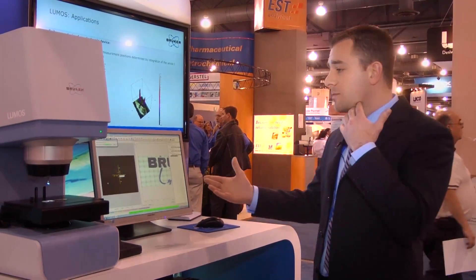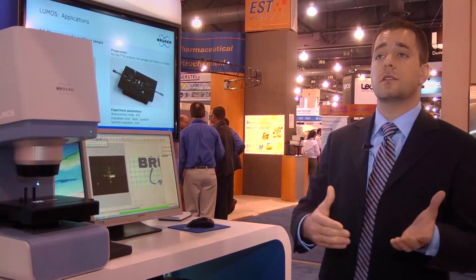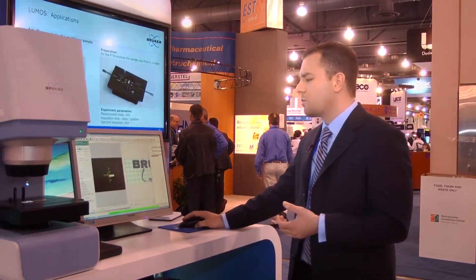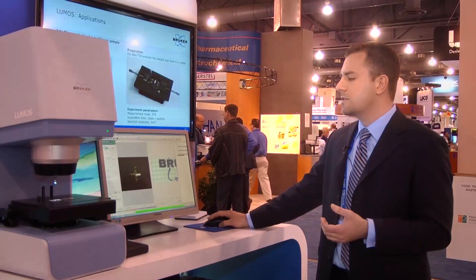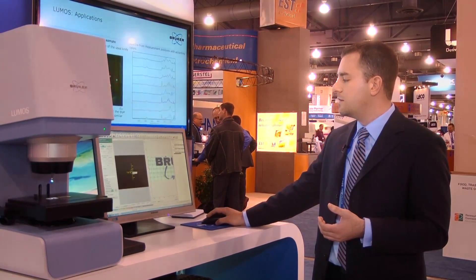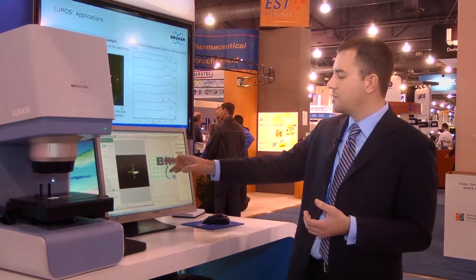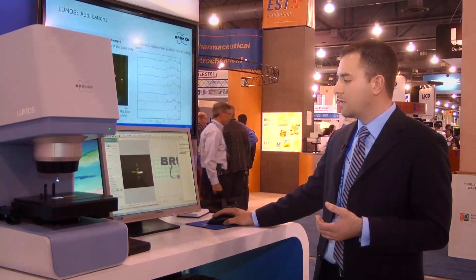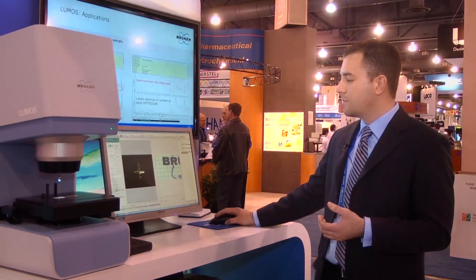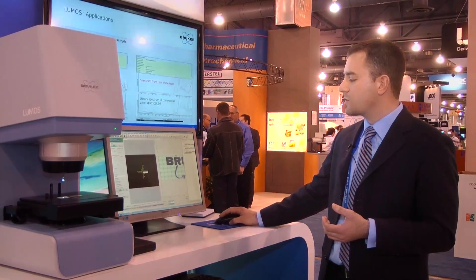Our background is complete, and now we're able to go ahead and take our analysis area. I can do a couple of spots, or I could do everything from drawing a large grid and doing mapping of individual areas. I could also do a line map, or I can do a spot-by-spot analysis, which is what I'm going to do.